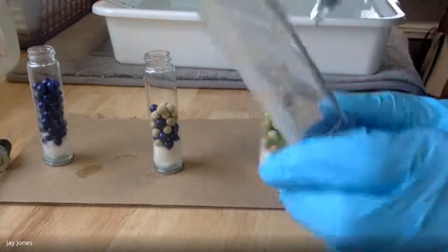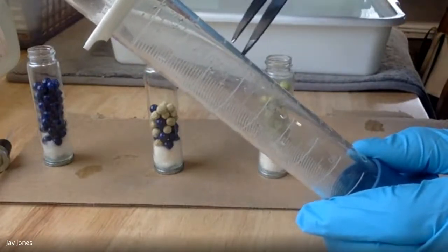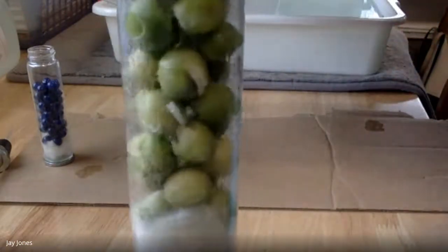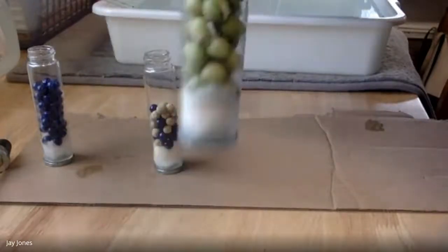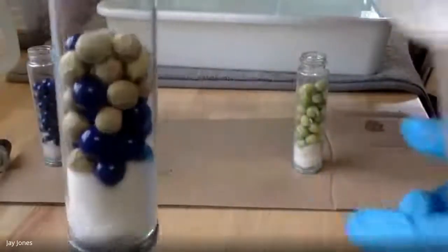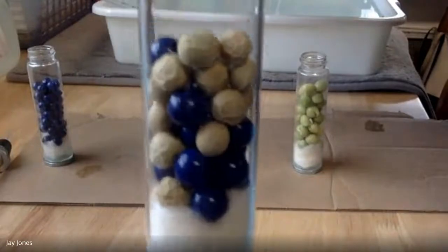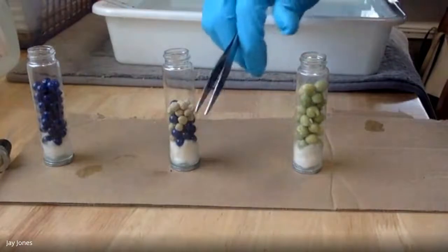It was really easy. I just filled this up to 50, put the peas in here, and it went up 10. So the volume of the germinating Alaskan snow peas is 10. Then I took 25 dry peas and put them in water for like 10 seconds. The volume of 25 dry peas is not 10 mLs, so I had to add beads so that the volume is the same in both of these.